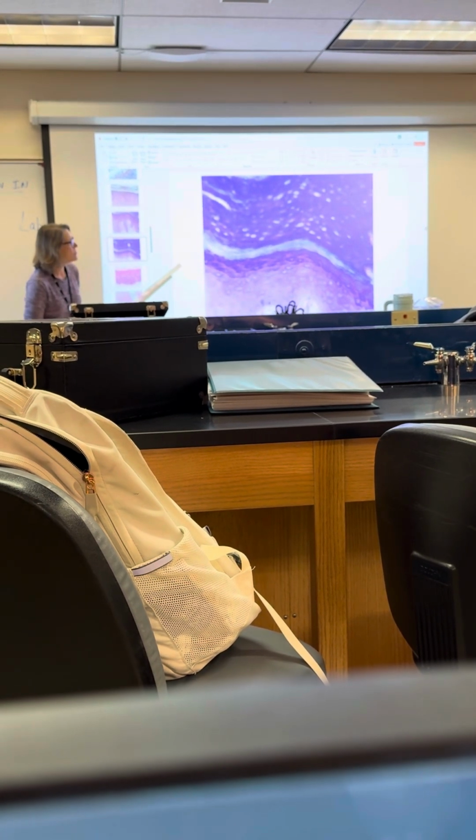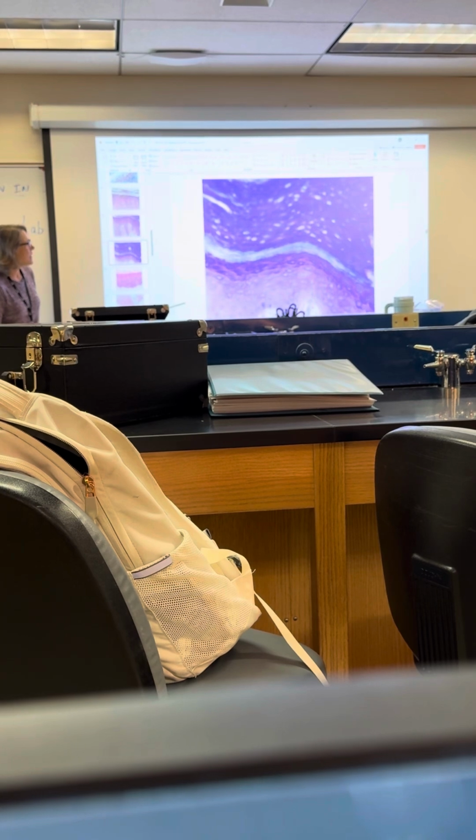That is sort of our high power slide. Does that look familiar to you guys? Okay, so let's go down to this one here, and then this one. Stratified. This is because this is our basement membrane down in here. So we do have a stratified, and then what's our shape? It is squamous. We're getting closer to the apical surface here, and these cells are flat. So they are a squamous shape. So it's a stratified squamous epithelial tissue.